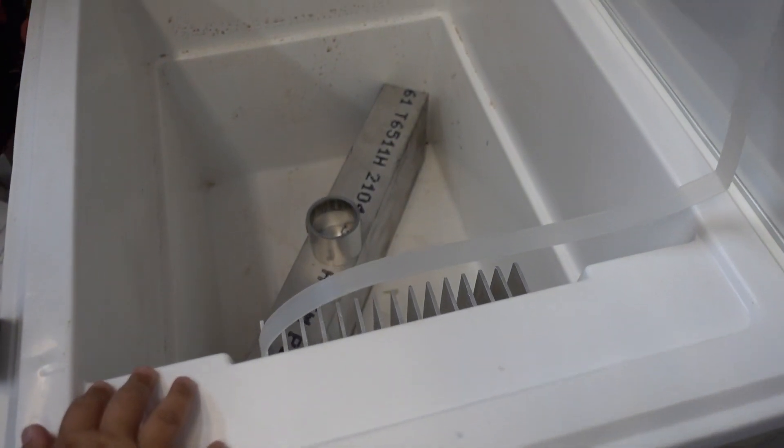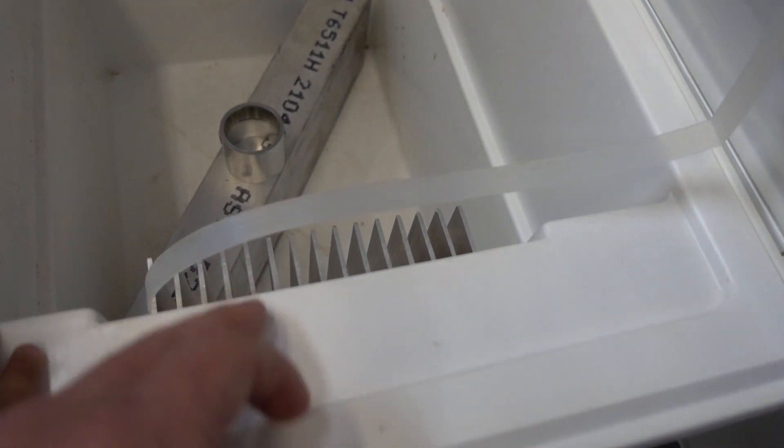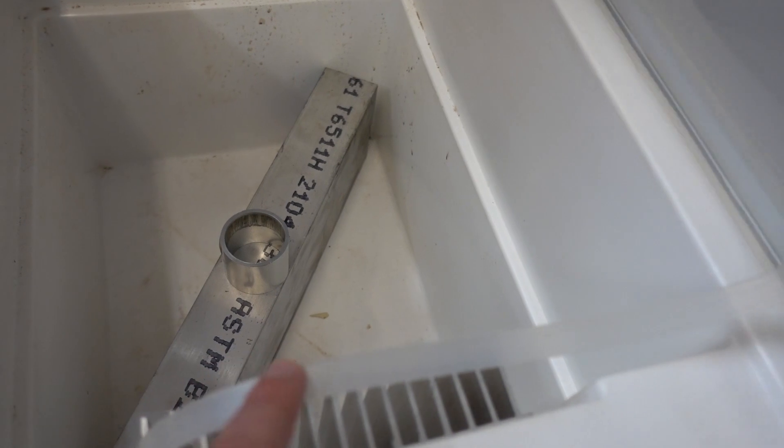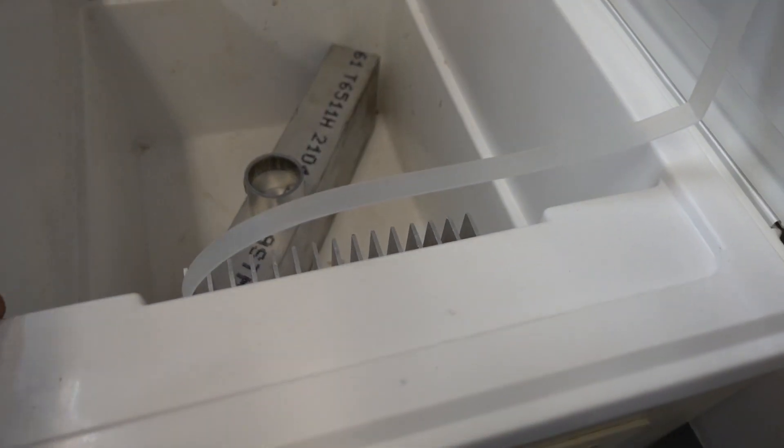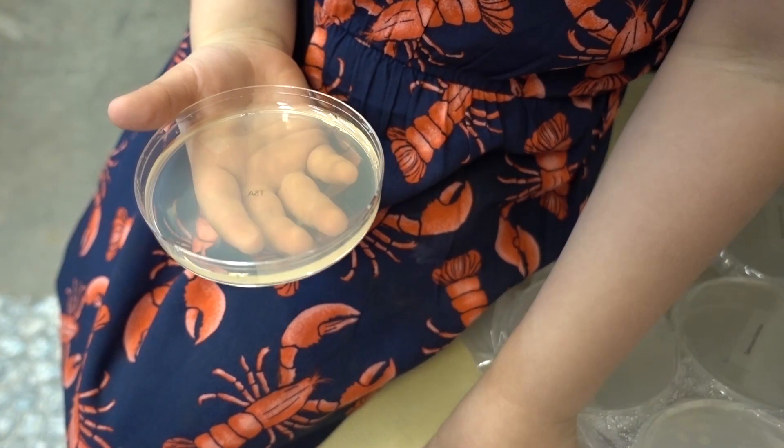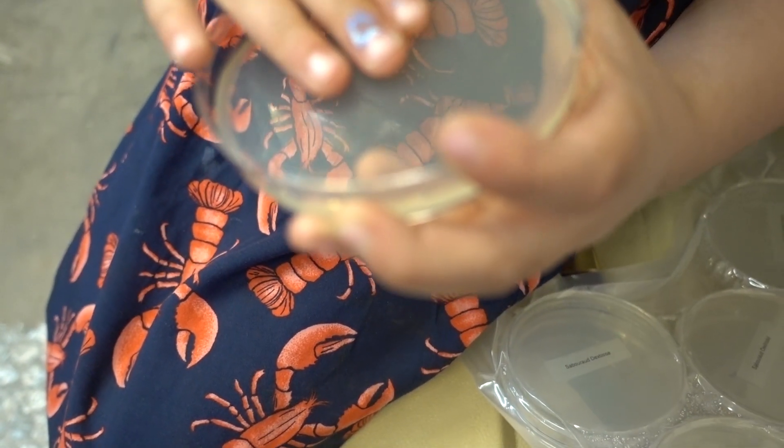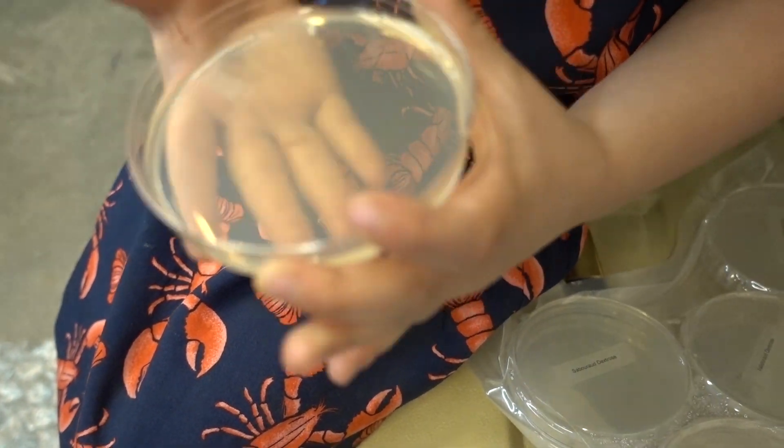This is our incubator, boys and girls. It's an old cooler that will heat and cool, and I've put a big old piece of aluminum in there as a heat sink to keep the temperature steady. Okay.